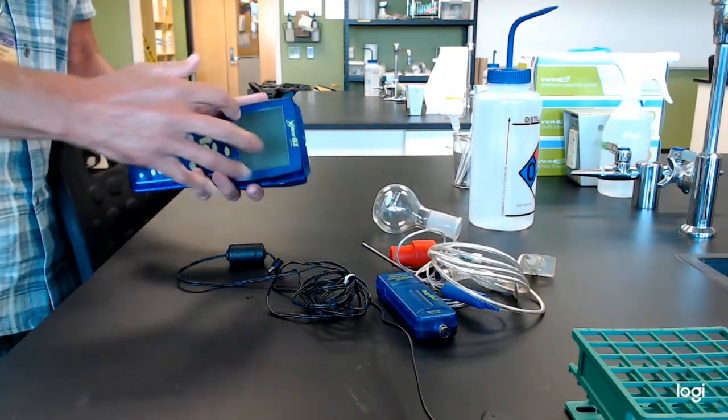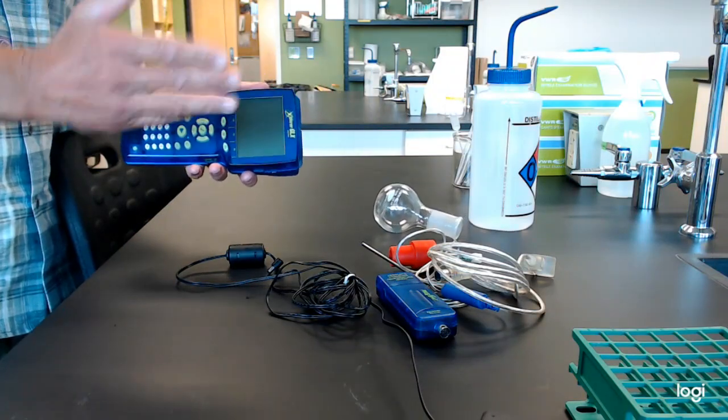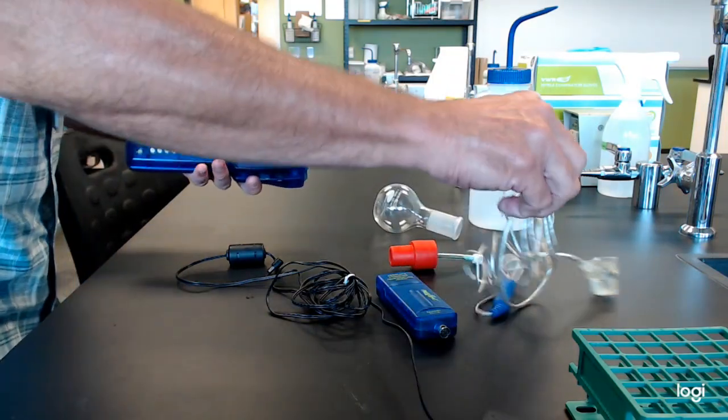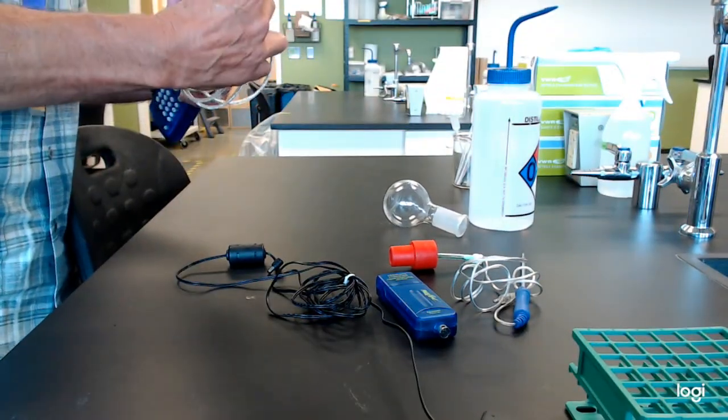The general thinking behind this data logger is it's got a little microcomputer in there, and when you turn it on, it looks out to find the sensor. Before you turn it on, it's just a dumb, stupid computer in that way. It's not like Windows-based.